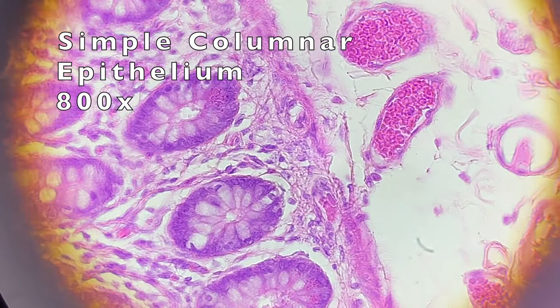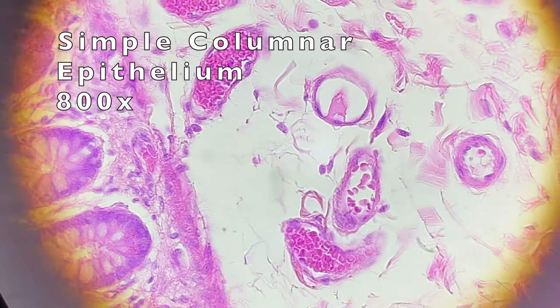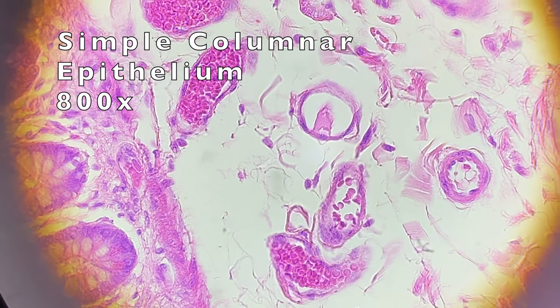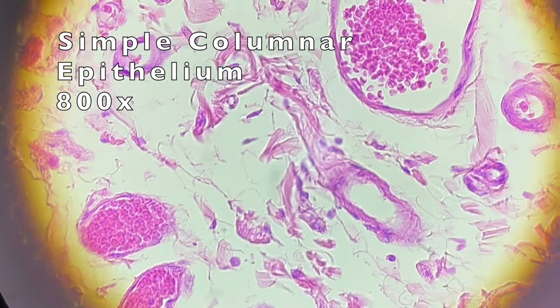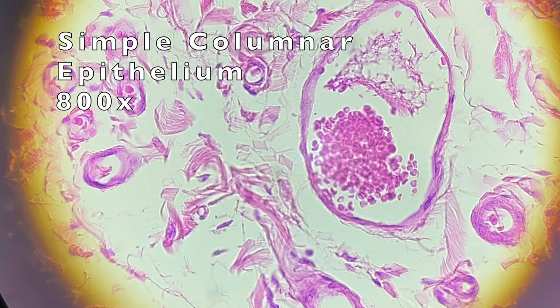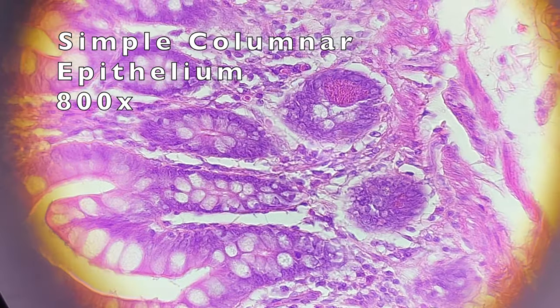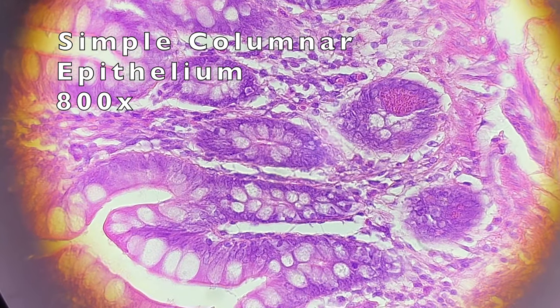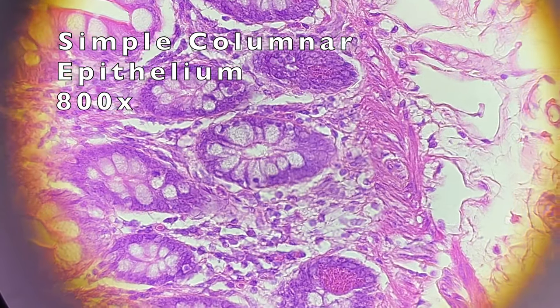In this region we can clearly see it is very vascular — many blood vessels and many red blood cells inside of them. The region we were looking at previously would be the interior, the inside of the tube that is your small intestine.